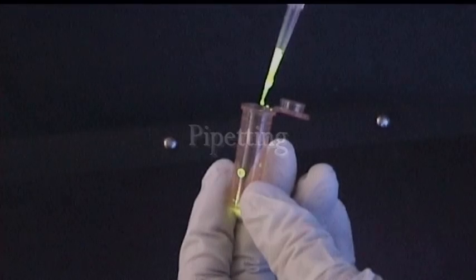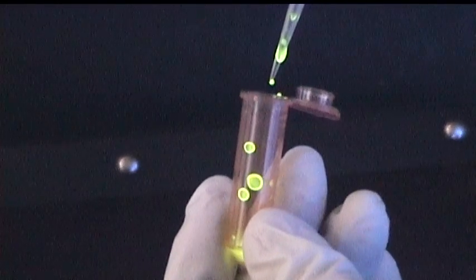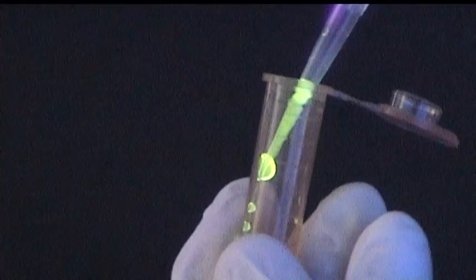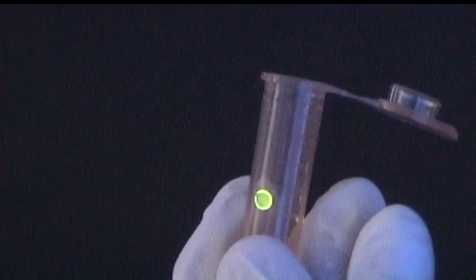Pipetting can also be a source of aerosols, as demonstrated in the next clip. Pipetting fast above the Eppendorf tube results in splashes on the edge of the tube as well as on the gloves. It is therefore better not to blow out the liquid, but to gently release the liquid while touching the inner surface of the receiving tube or other vessel.